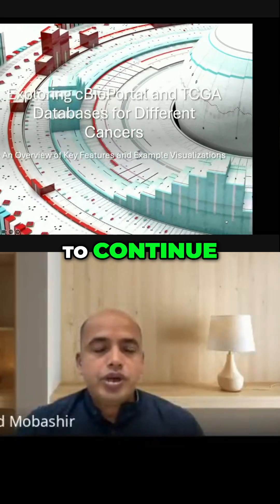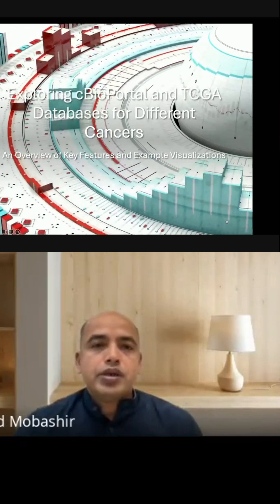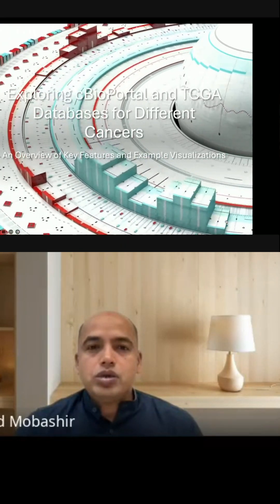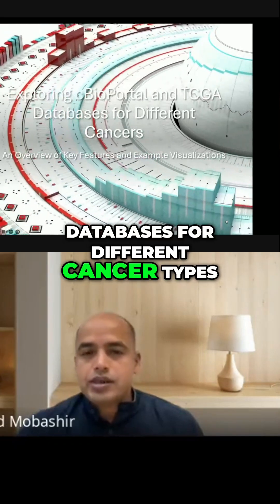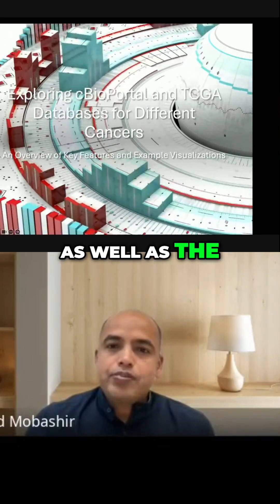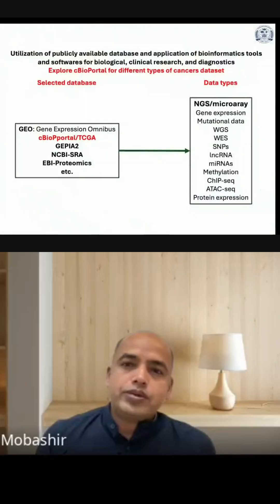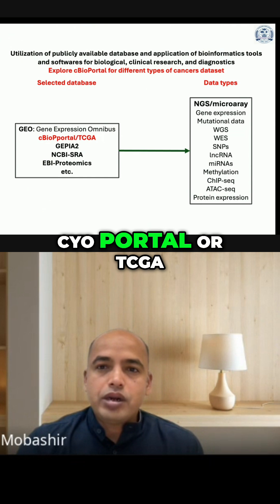Today I am going to continue the previous talk where I will be discussing how to properly use cBioPortal and TCGA databases for different cancer types. It includes the introduction as well as proper data exploration for specific types of cancers. Here is the previous slide where I had mentioned cBioPortal and TCGA as the major sources of cancer datasets.